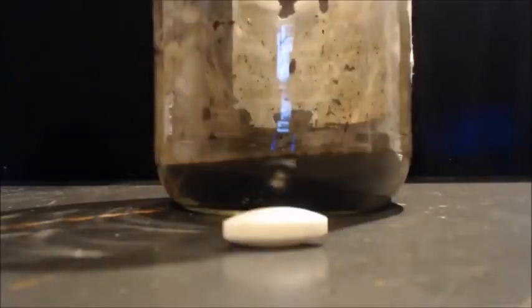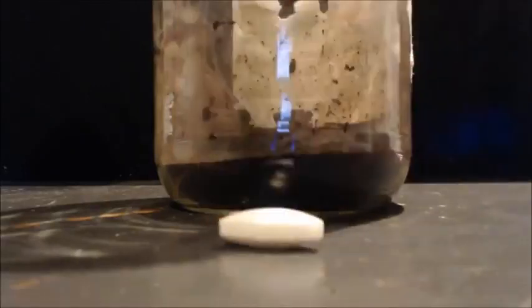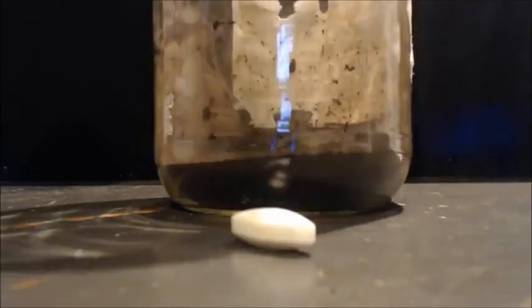Basically, I'm going to put this stir bar in, which I found too. I moved the dresser out, or desk, or whatever you call it, in the kitchen, and there it was underneath. I found one. I started out with 7 stir bars. A good tip, because this is how I lose them most of the time: I filter them out, and then I forget them. I throw the filter out, probably because when I'm doing it over and over and I can't get the crap out, it gets you frustrated. And then you end up throwing your stir bars out with your filter paper.